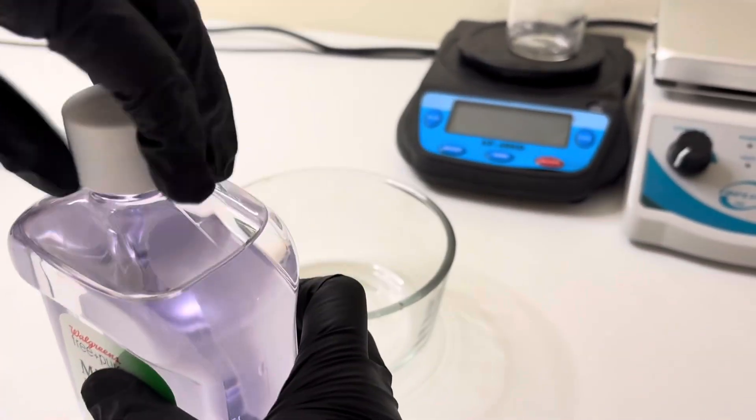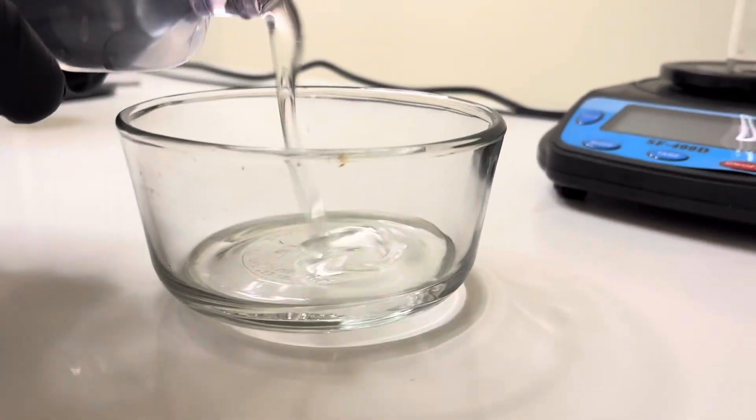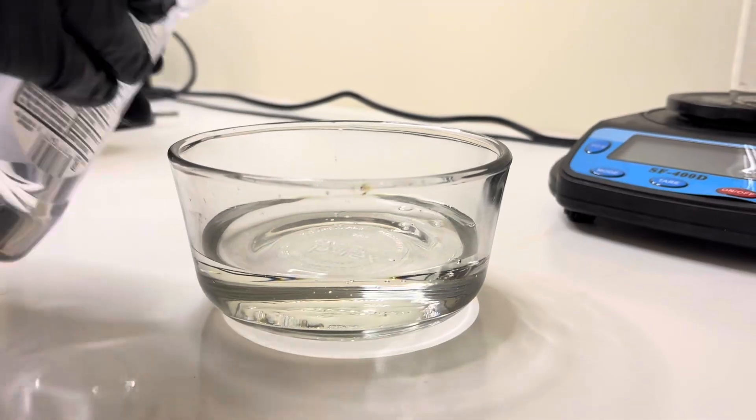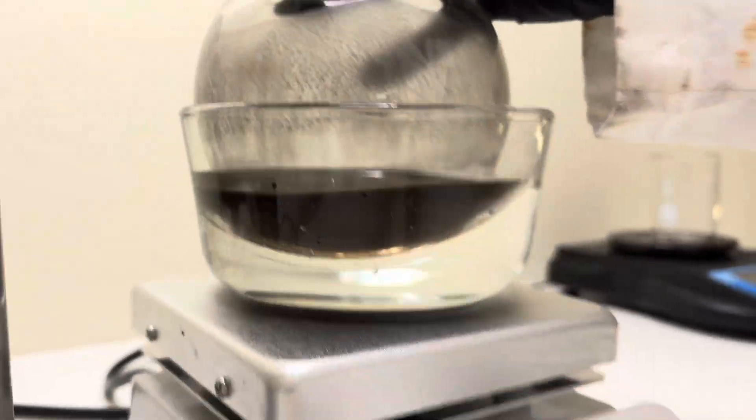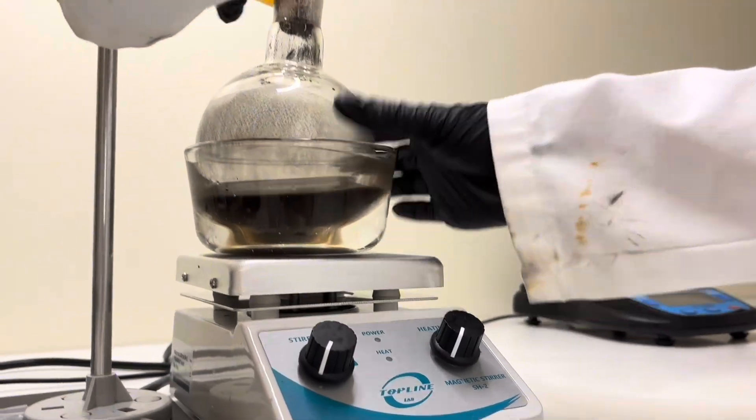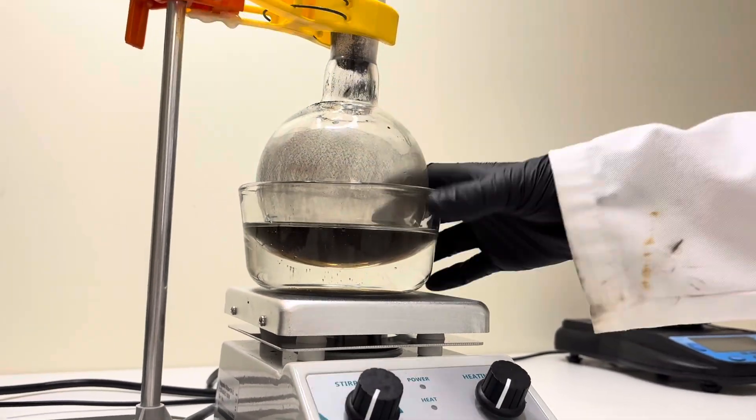I'll heat the reaction safely and evenly using an oil bath. I'll set the oil bath to about 60 degrees Celsius. That's warm enough to accelerate the reaction without causing over-oxidation or decomposition.